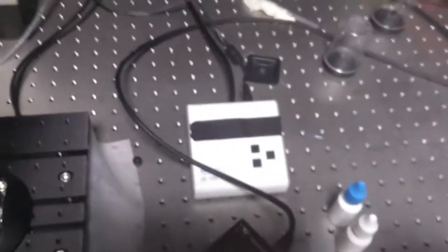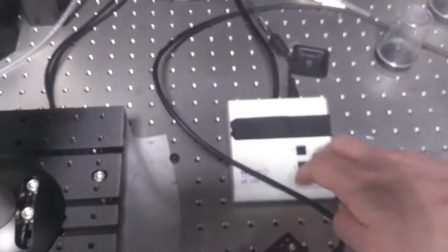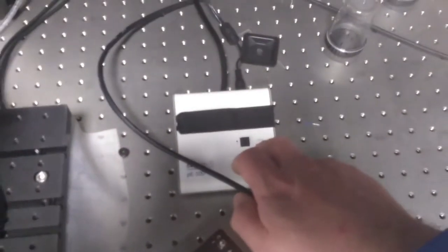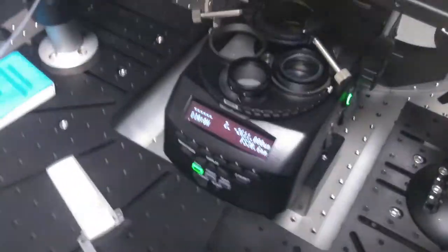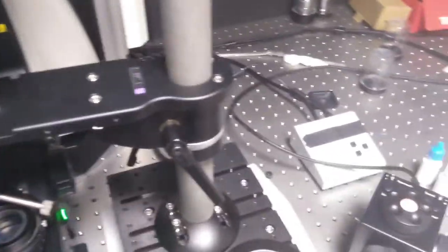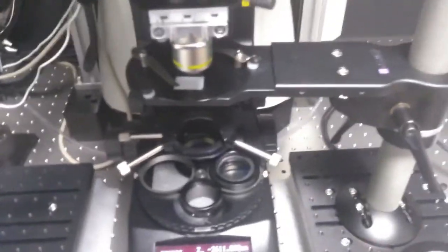If you are using a sample that requires bright field to focus, you can use the bright field illumination, and this will allow you to use transmitted view instead of fluorescence. The controls for switching fluorescence mode can be found in the software.